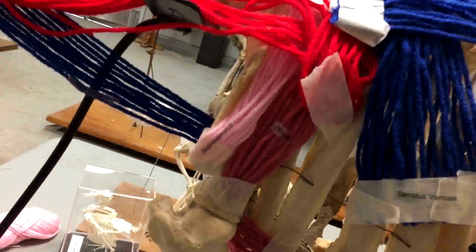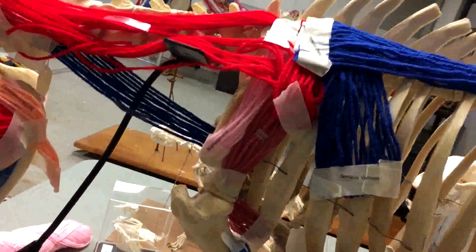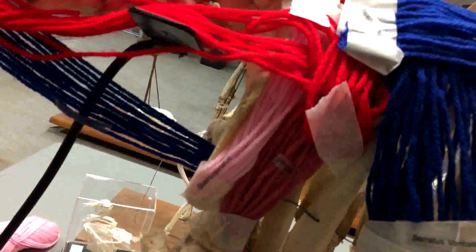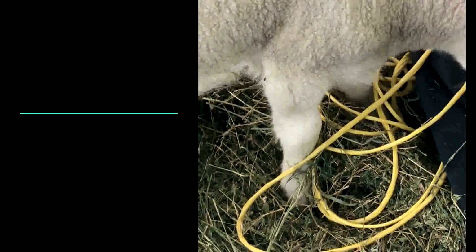The supraspinatus muscle crosses the shoulder joint and inserts laterally on the greater tubercle of the humerus. It originates on the fossa of the scapula and acts as a brace to the shoulder and part of the rotator cuff, allowing for smooth movement of the limbs and general support.